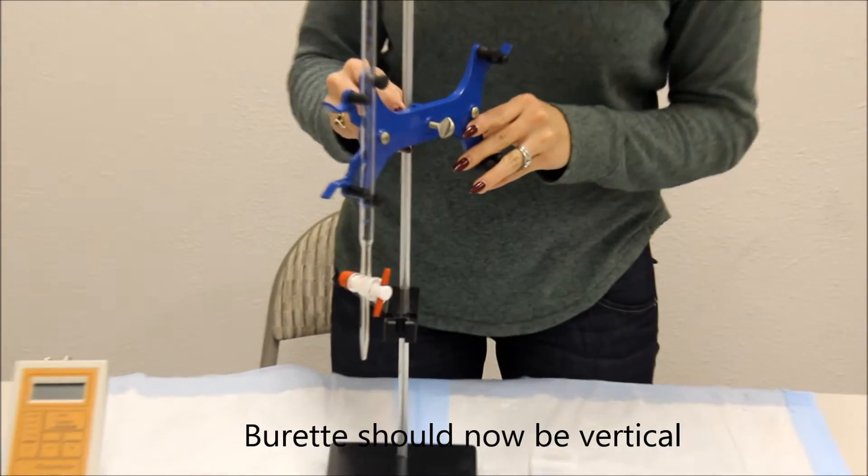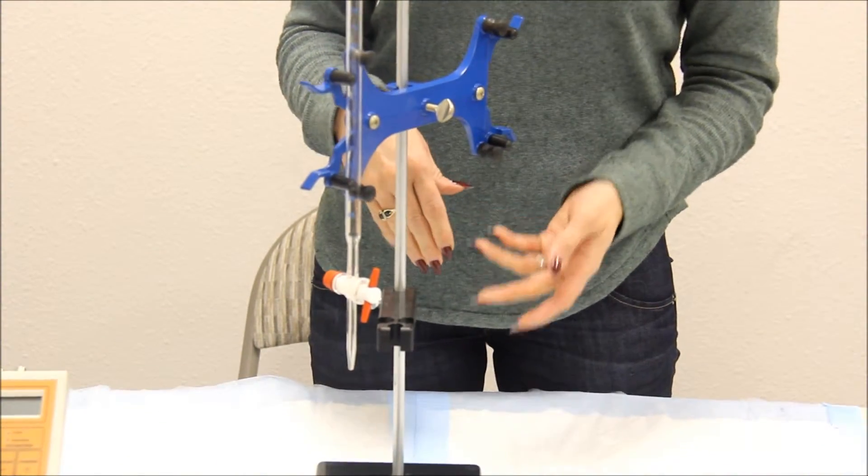You can now add your SO2 or pH electrode.